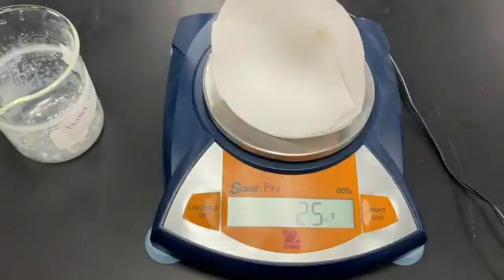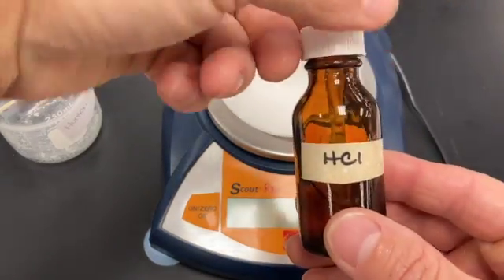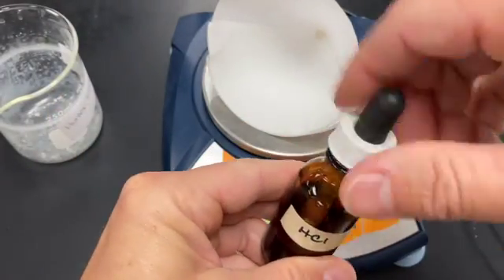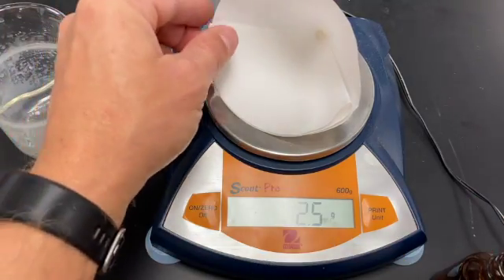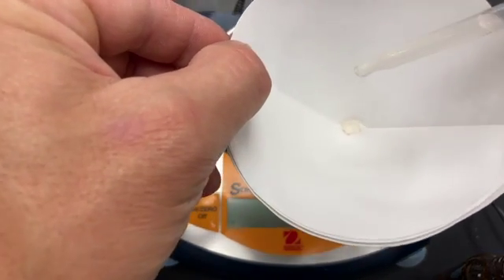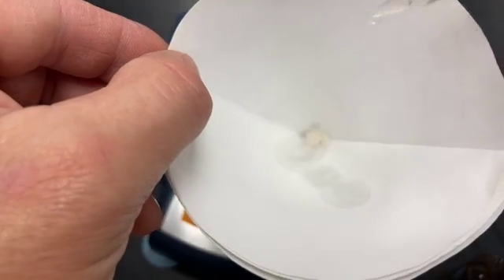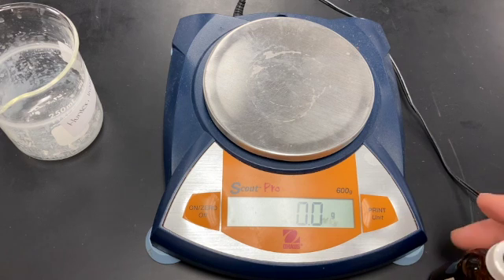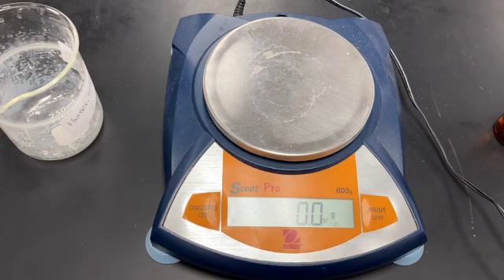Now, how do we know this is limestone? Here's the test. You guys remember this test? It's fizz. We've got HCl here, a little weak acid. If this has calcium carbonate in it, which it should, we should be able to make this stuff fizz when we put some acid in there. Oh yeah, really good. You can hear it going. If you want to test yours, you can. There's some acid over here. Go ahead and get your masses, subtract, and answer the questions, and we're done with the lab. There's a quiz online.